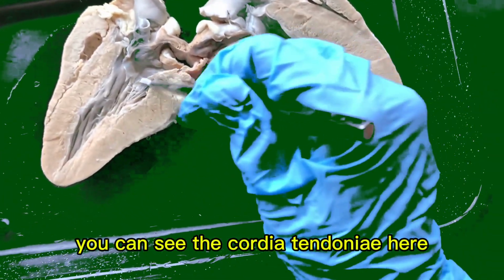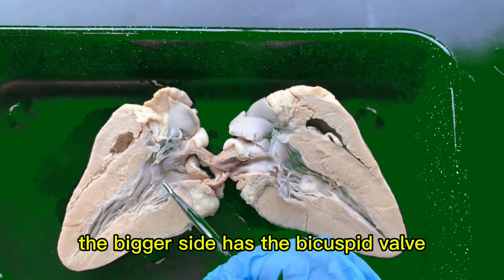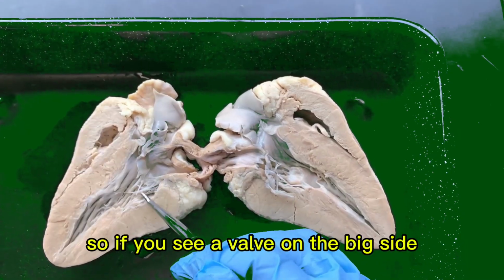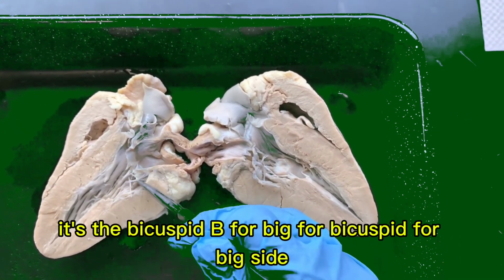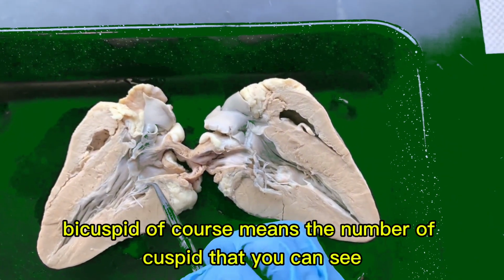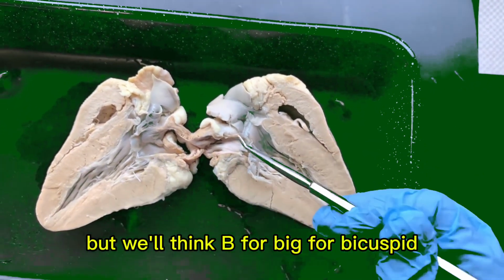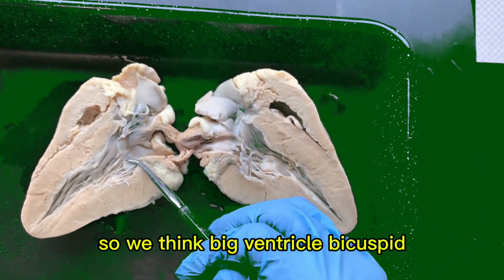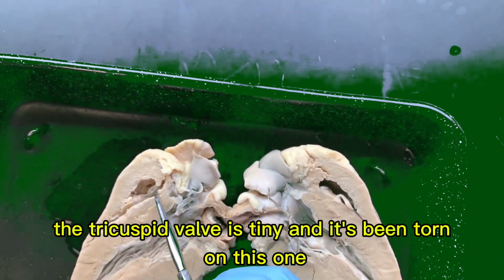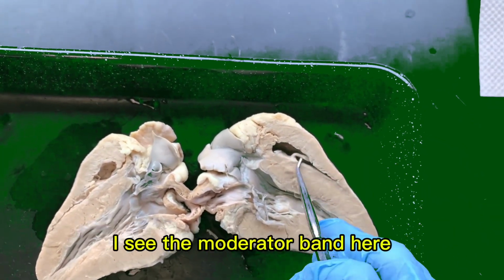You can see the chordae tendineae here. And you know that on the left side, the bigger side has the bicuspid valve. So if you see a valve on the big side, it's the bicuspid. B for big for bicuspid. Bicuspid, of course, means the number of cusps that you can see. But we'll think B for big for bicuspid. So we think big ventricle, bicuspid. The tricuspid valve is tiny and it's been torn. On this one, I can see the moderator band here.